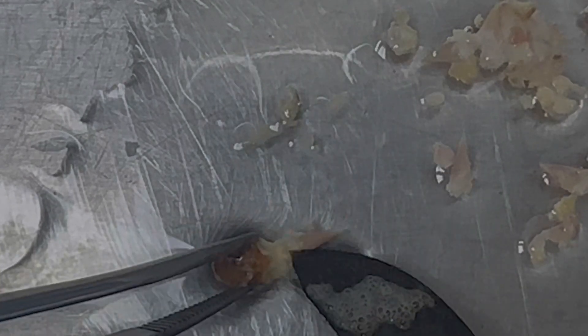The easiest way to do it is just get rid of as many leaf primordia as I can — get the smallest explant possible. Because if you get into those inner layers, they are essentially sterile. So that makes your percentage success of getting the plant into tissue culture a lot higher than trying to sterilize an entire node.